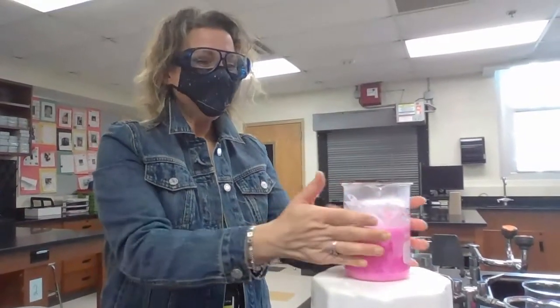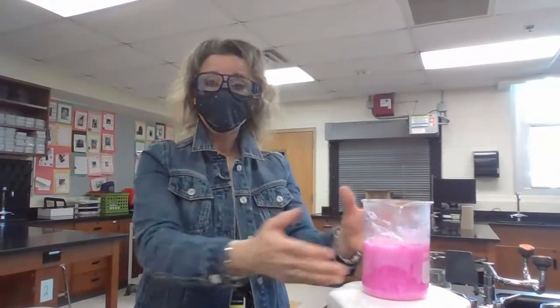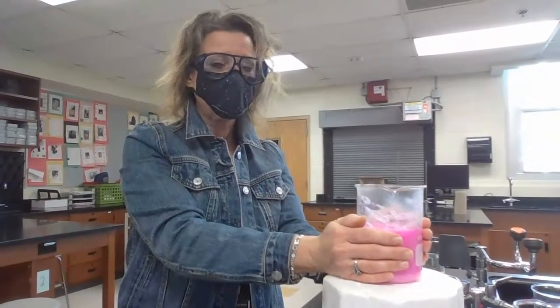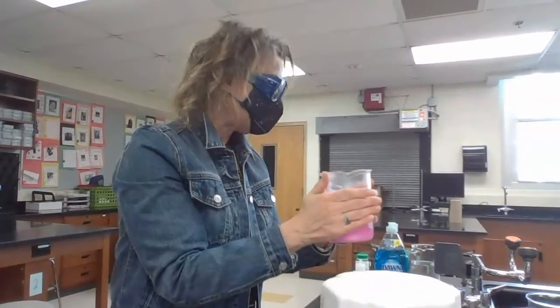Uh-huh. Now, so calcium, oh, that feels so good. So calcium is in the same period as potassium, but it's not in the same family. And did the calcium burst into flame? Nope, it didn't. So think about what's happening as you go across this period. You had potassium, which burst into flame, and you had calcium, which, what do you think? It's a pretty nice reaction. Pretty nice reaction, but no fire, no explosion. I know you all are very disappointed about that. But that's what happened with our calcium.